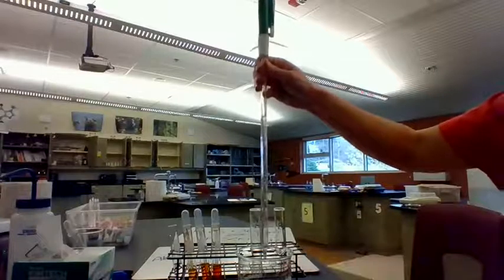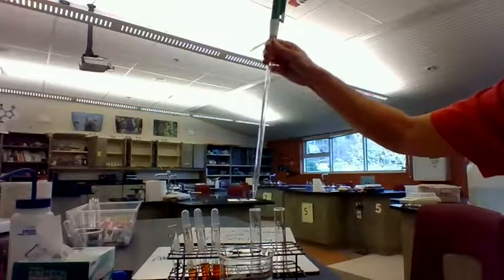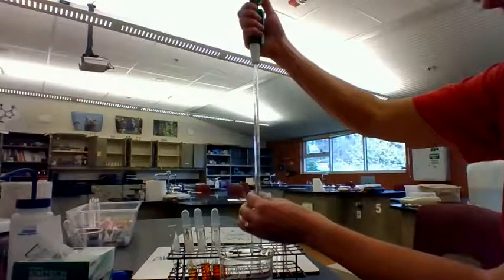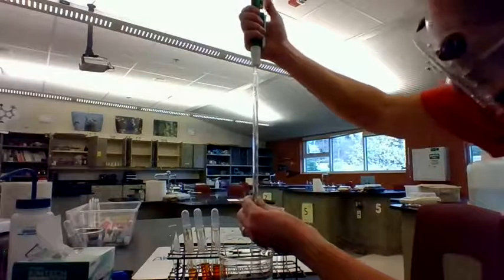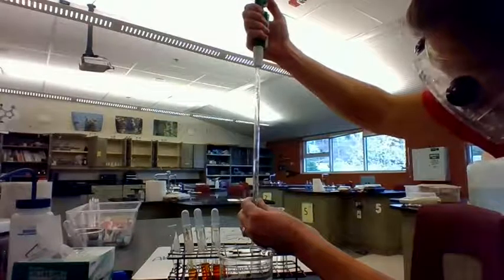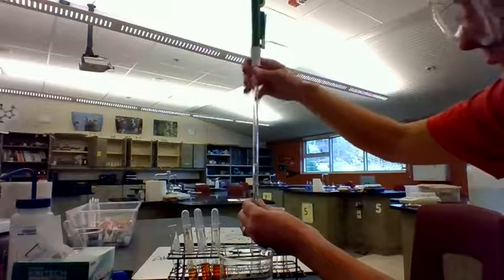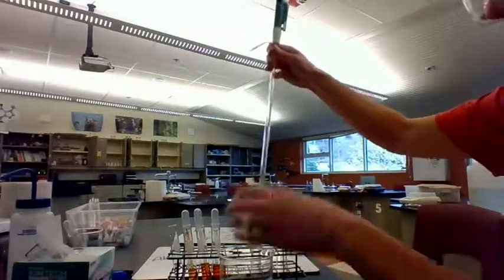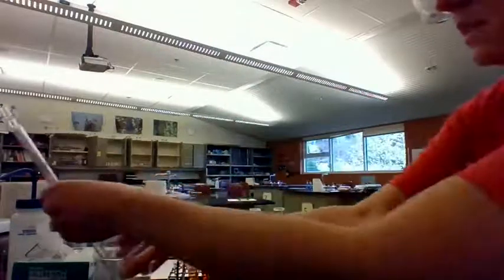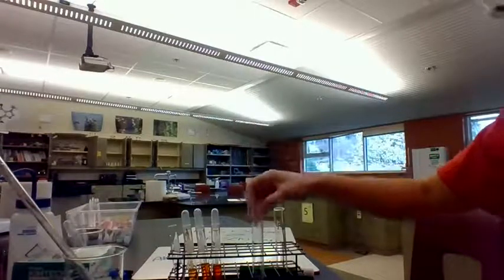And now if I want to add 4 milliliters of this solution to this test tube right here, I'm going to go over here and dial it the other way. And I'm going to carefully dial it down until I stop exactly at the 4. And we want to read from the bottom of the meniscus. So I have now added exactly 4 milliliters to my test tube there. All right, and I'm going to put this solution aside. So this is my 4 milliliters of iron.